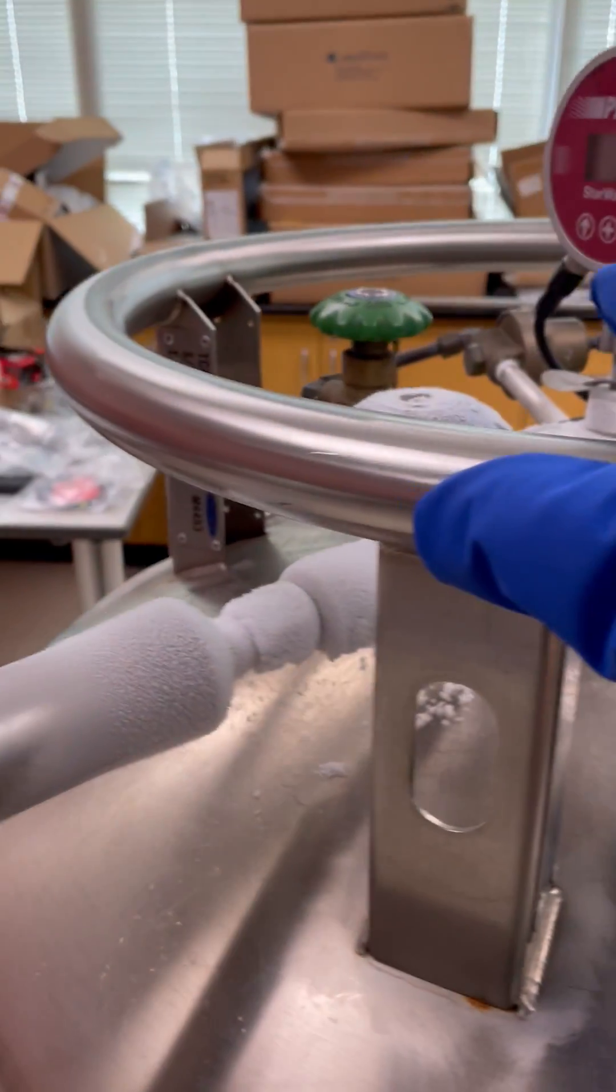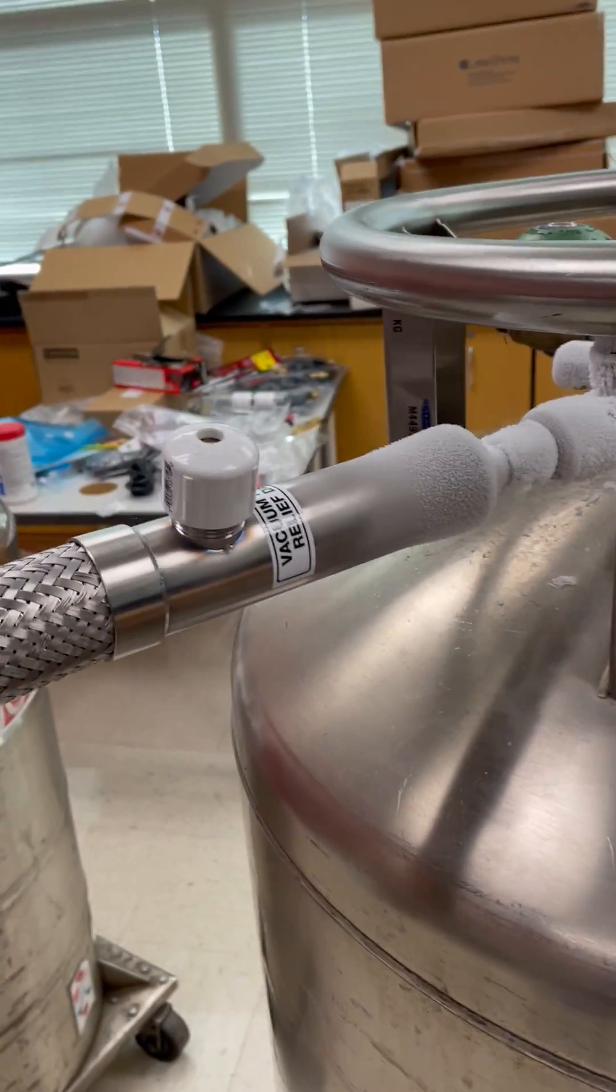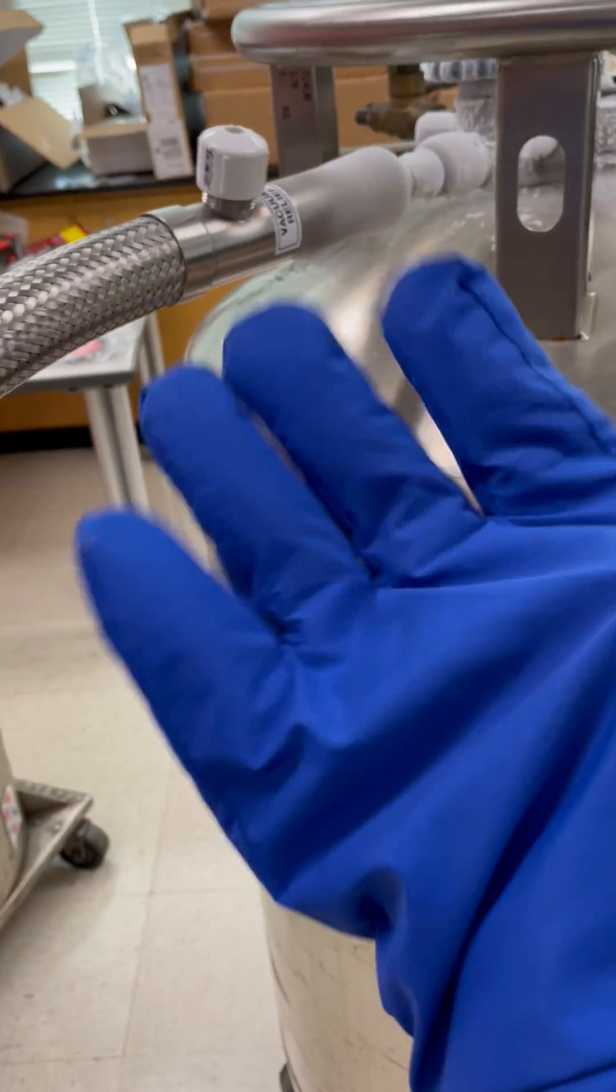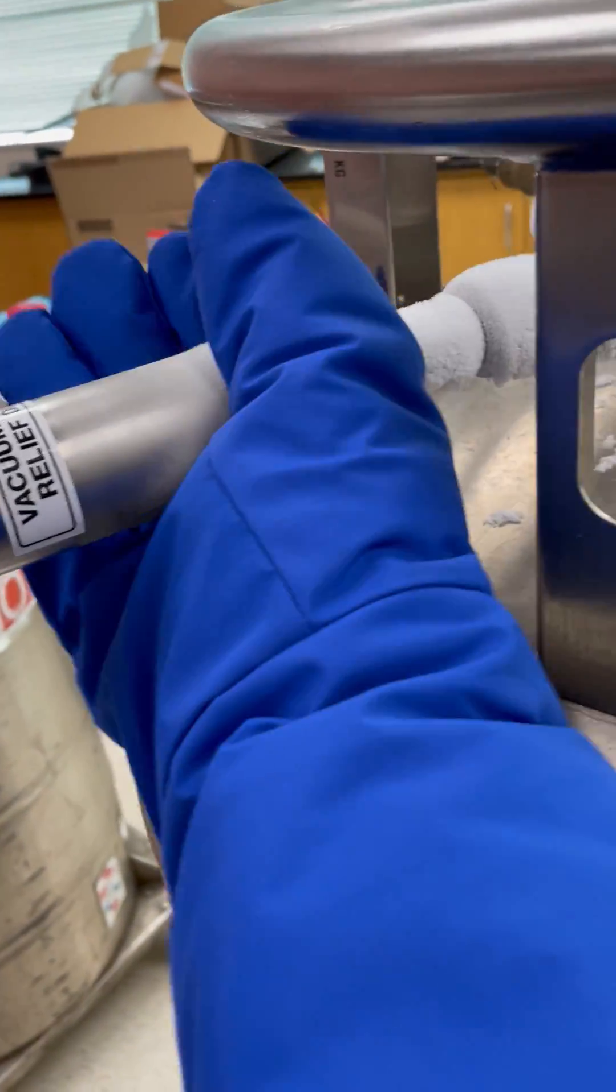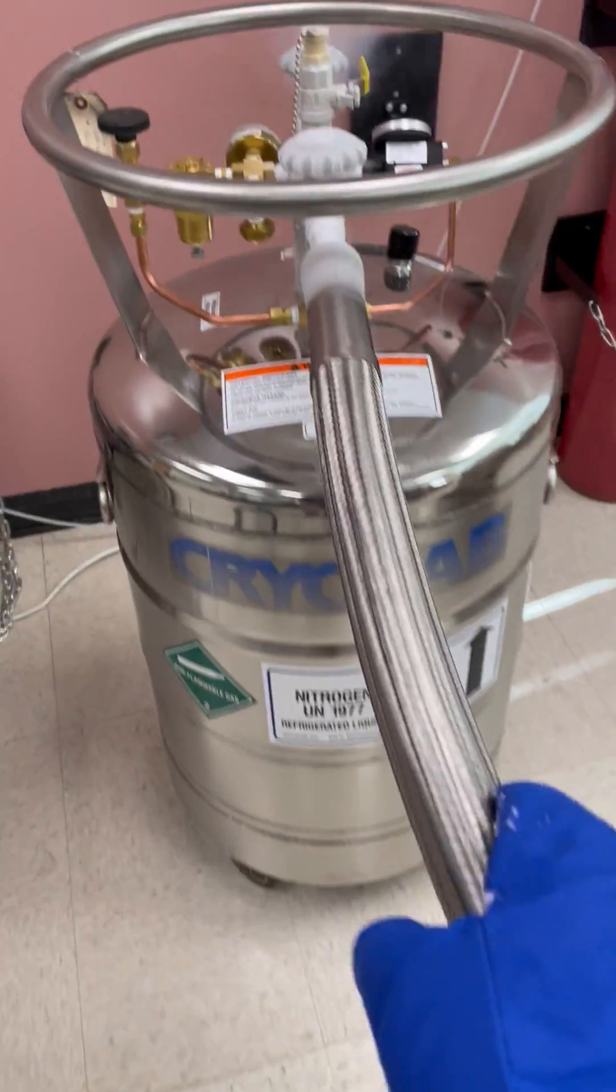But anyway, in order to transfer it, of course, put on your safety glove, that is important. And then have a wrench to tighten the transfer line from the source to the destination.